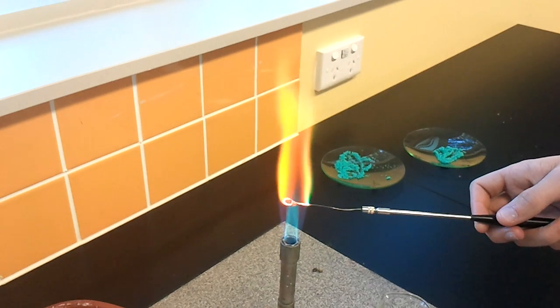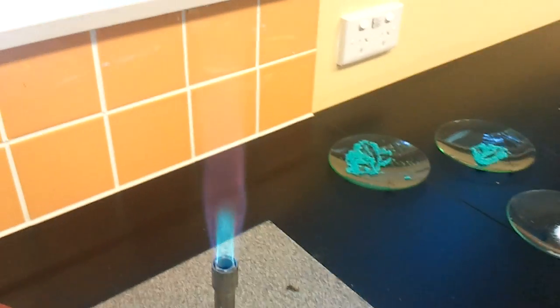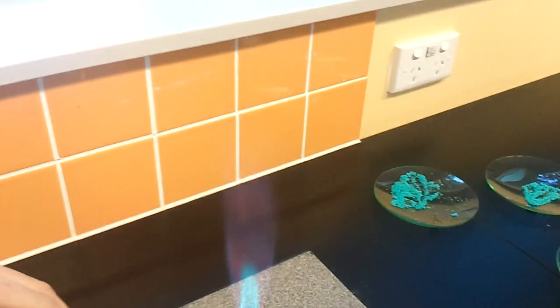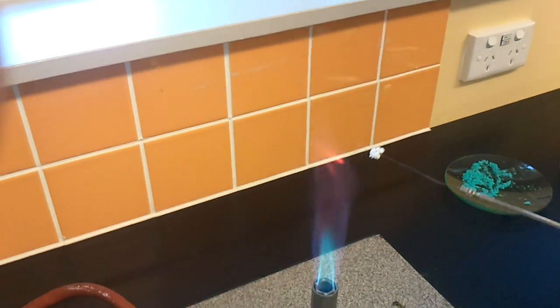And we have to use... I like the red. I like the red. Oh no, oh no. That kind of looks like it's melted. Stop putting that stuff in — it just smokes up.